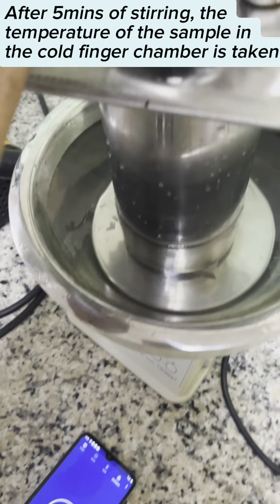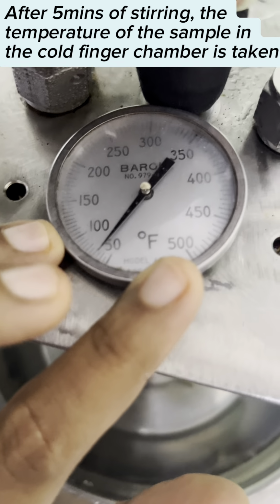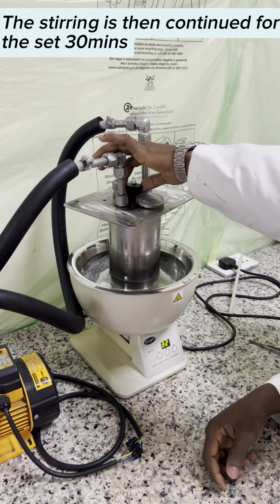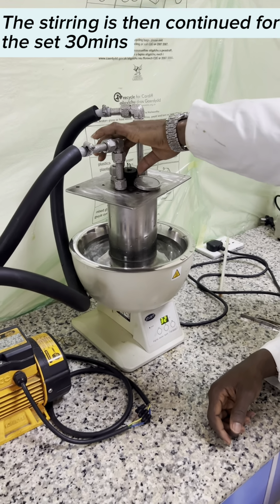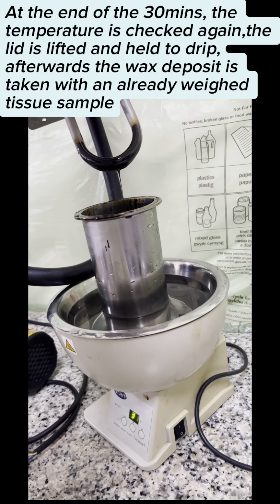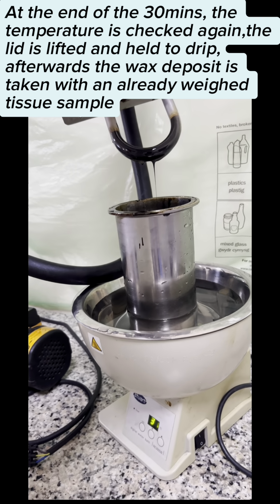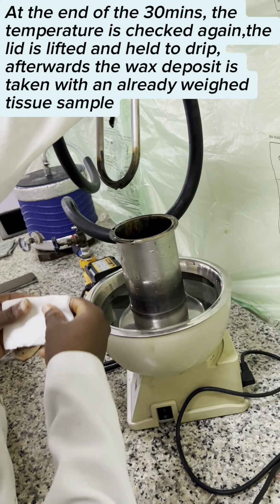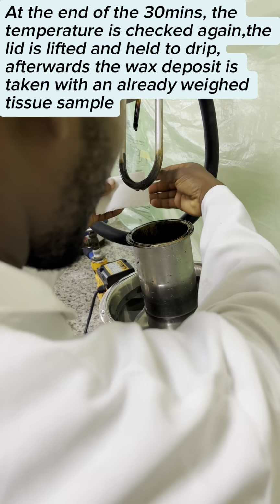After 5 minutes of stirring, the temperature of the sample in the cold finger chamber is taken. The stirring is then continued for the set 30 minutes. At the end of the 30 minutes, the temperature is checked again, the lid is lifted and held to drip. Afterwards, the wax deposit is taken with an already weighed tissue sample.